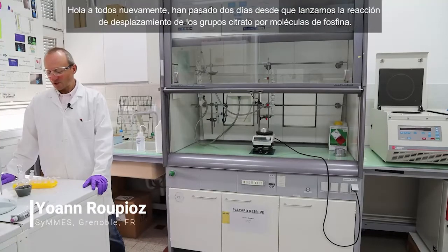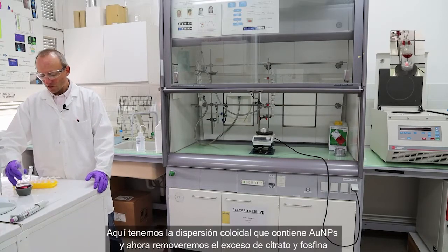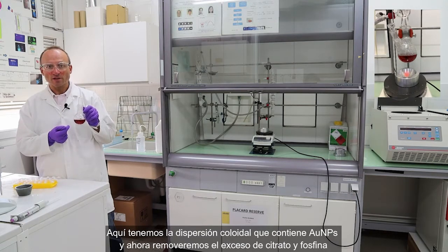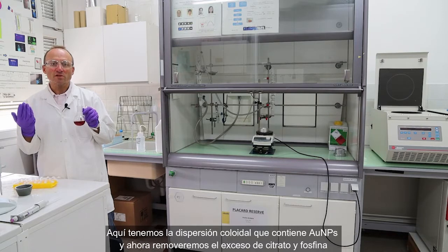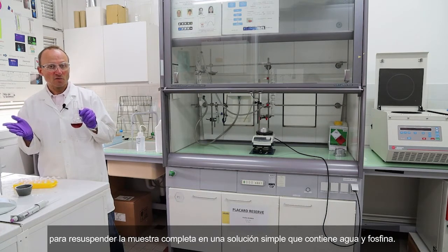Hello again, everyone. It has been 2 days since we launched the displacement of the citrate with the phosphine. So here is the colloidal solution containing the gold nanoparticles. Now we'll have to remove the citrate excess and the phosphine excess to resuspend the whole sample in a simpler solution containing just water and the phosphine.